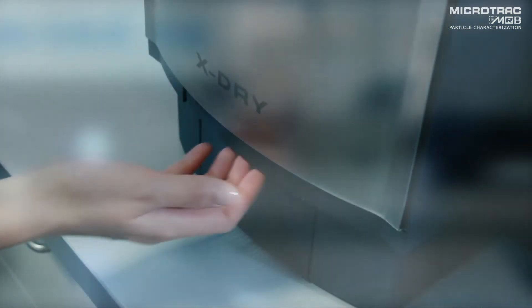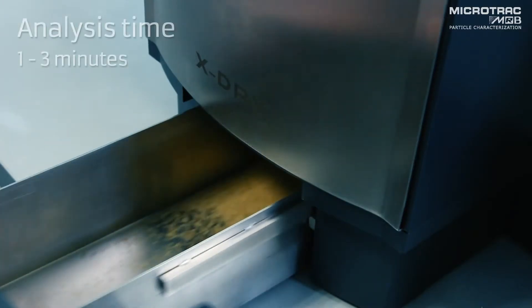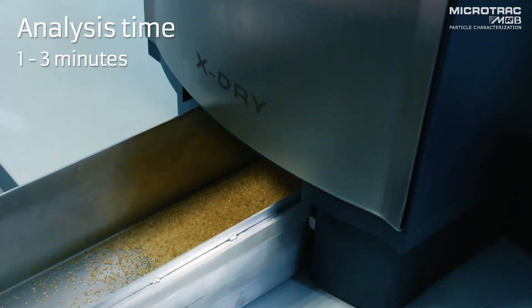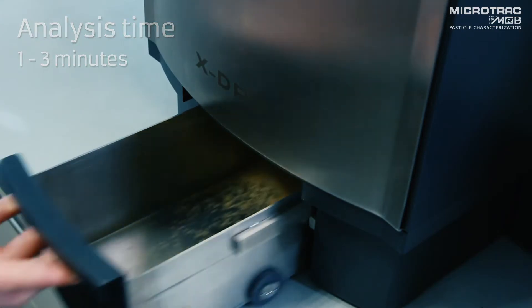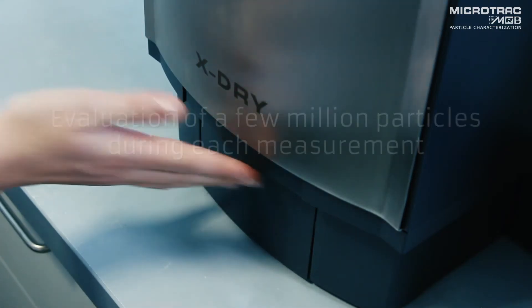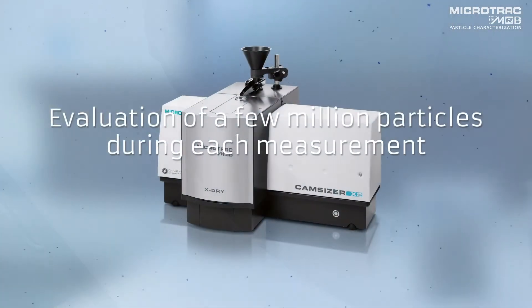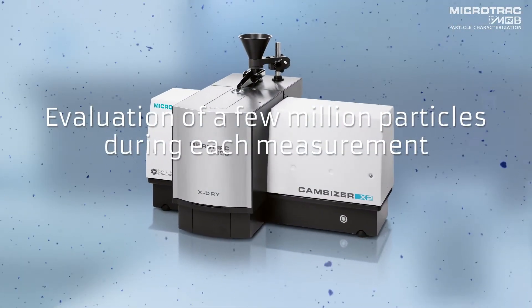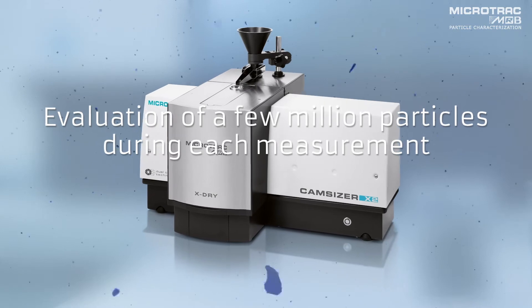The CamSizer X2 analyzes a large and representative amount of sample material in only one to three minutes, and typically evaluates a few million particles during each measurement.